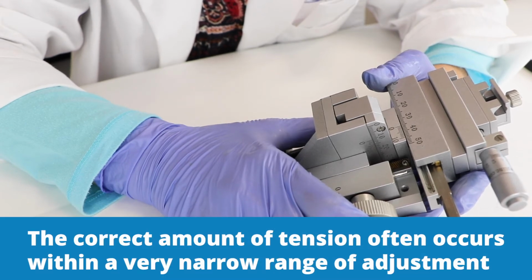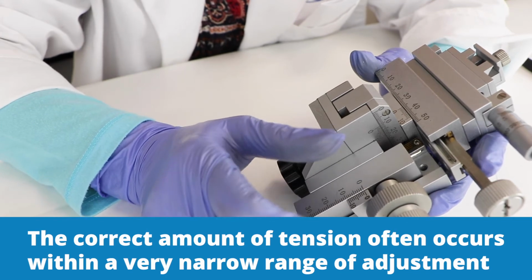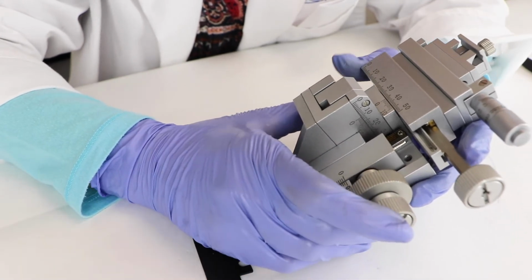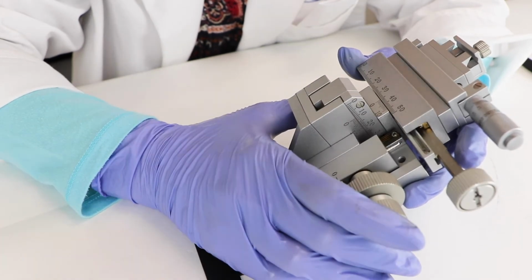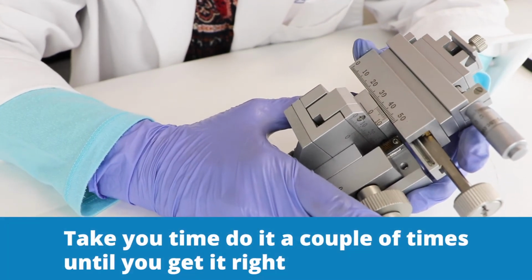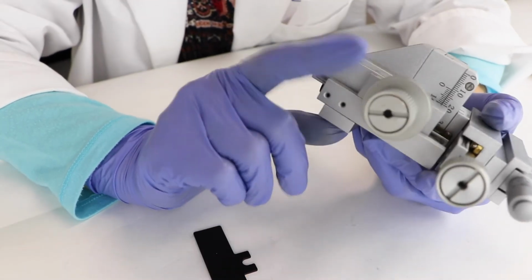The correct amount of tension often occurs within a very narrow range of adjustment. And if you make it too tight, the knob will be harder than necessary to turn and you'll wear out frictional components in here. So this requires patience. Take your time, do it a couple times until you get it right. And then you're going to do the same thing on the y-axis.